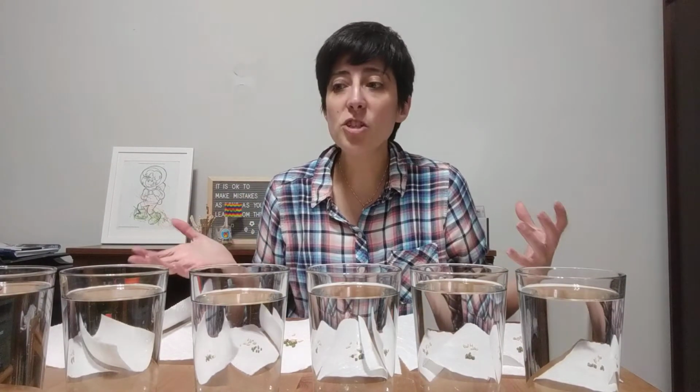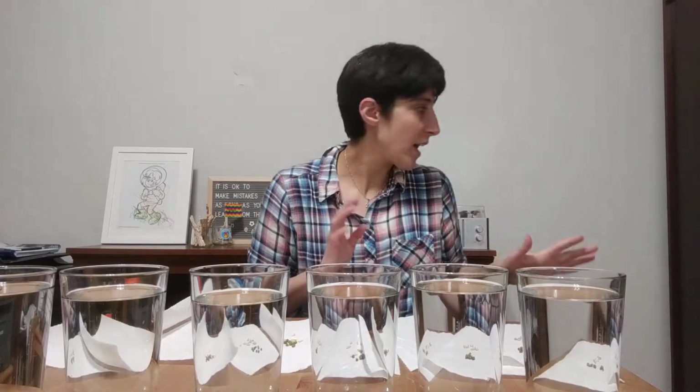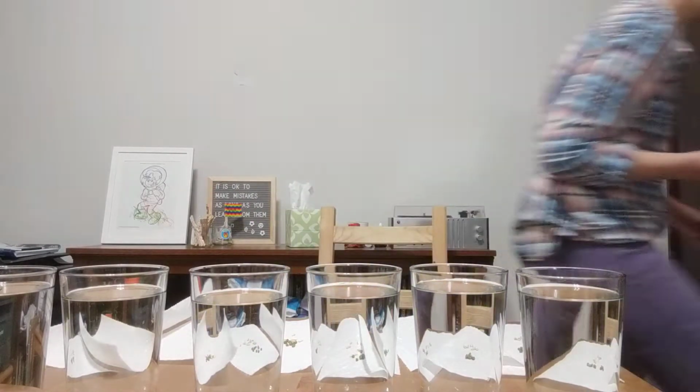Now I did just do all that before I stirred them up. I'm actually going to go ahead and stir them and then take the pH again just to make sure I have a good pH. And then I'm going to put these in. So I got to get my syringe.